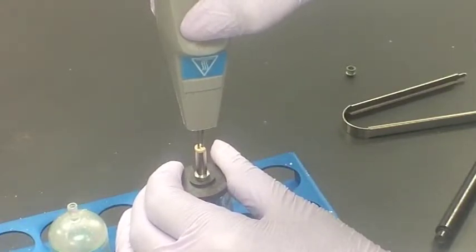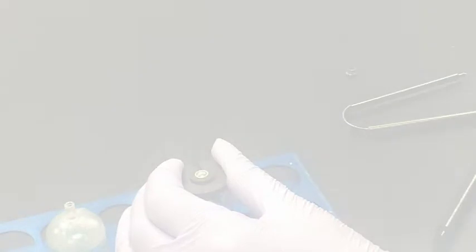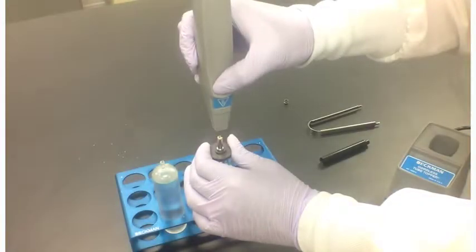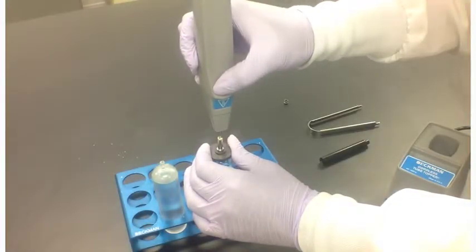When the seal guide has moved to the correct position, remove the tube topper and pinch the circular seal guide to hold the seal former in place.